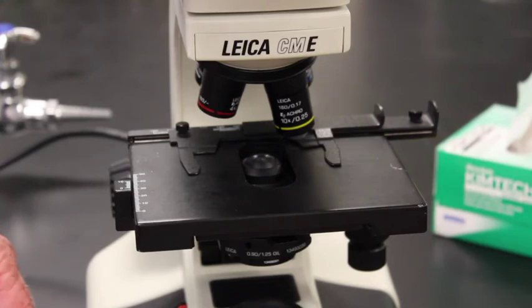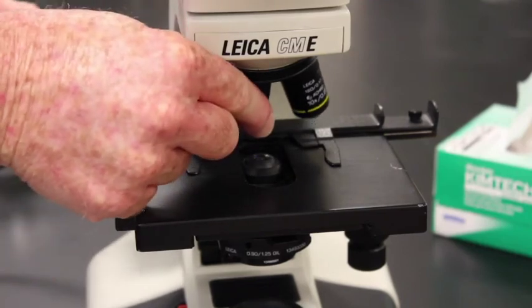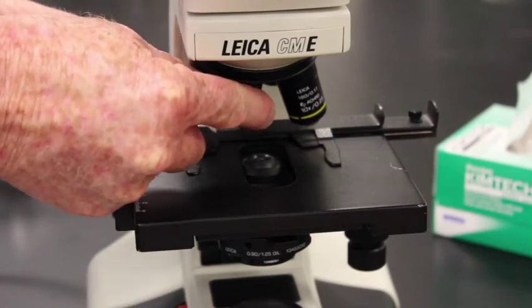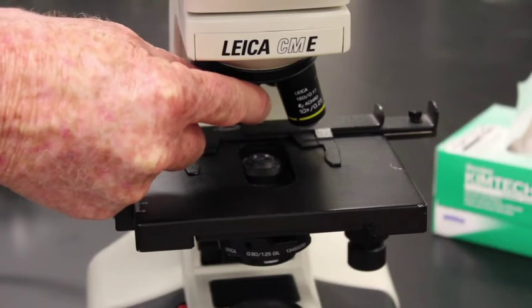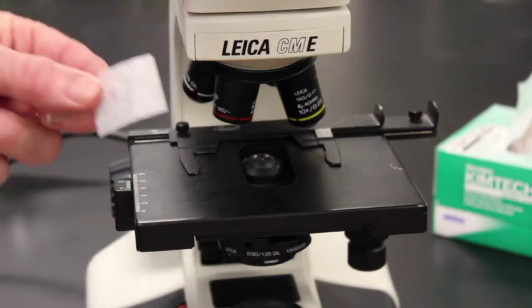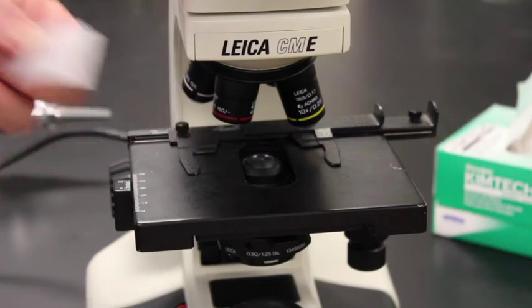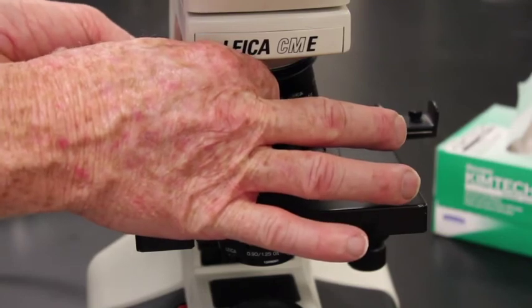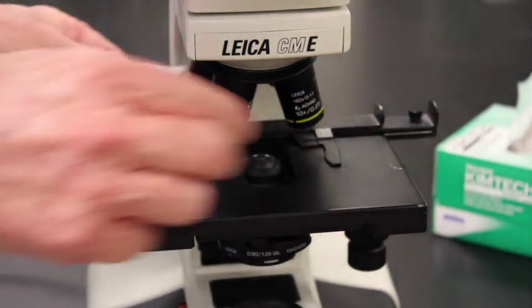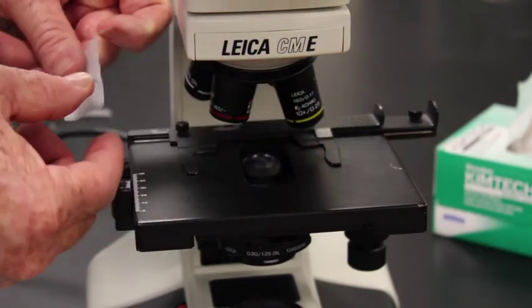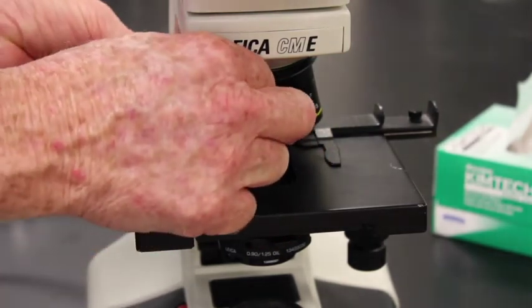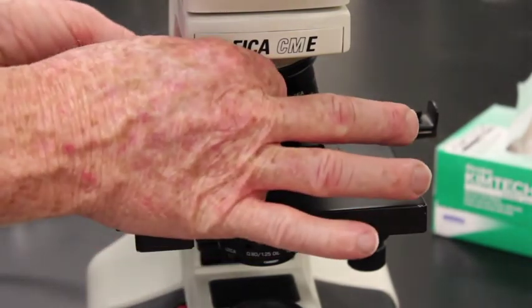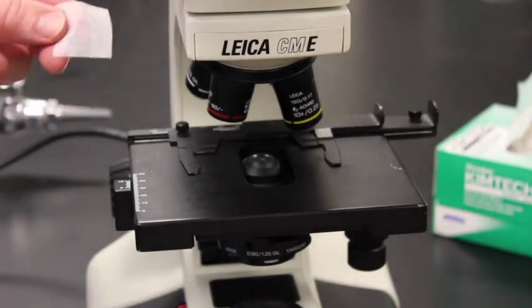Now if we go over here to the 100x objective, we have a lot of oil on the 100x objective. So I'm going to swivel it back over here. Here's my 100x objective. And if I wipe my 100x objective, we then can see all that translucence there of the oil on my 100x objective. So I'm going to want to go back and wipe it again. And really it might take two or three times with a real clean piece of lens paper where I wipe in various clean spots. I might shift it and go to a nice clean spot. And then I wipe it. I grab a brand new piece, wipe it. And if I have no translucence at all, it's ready to go.